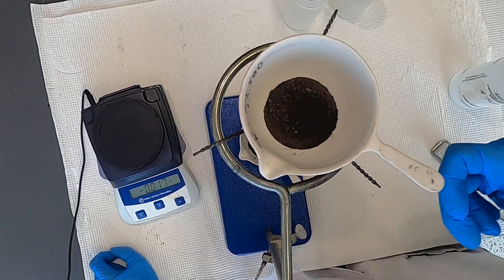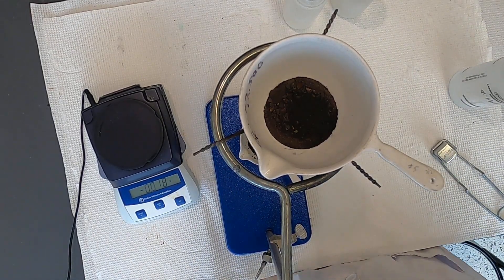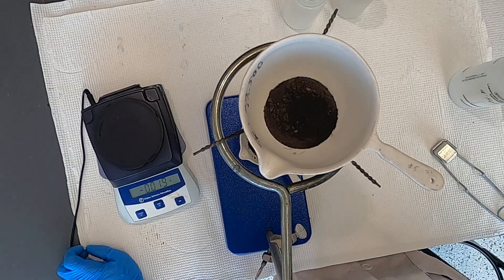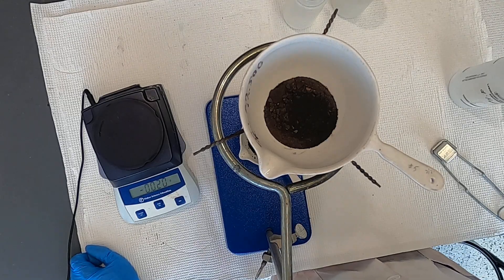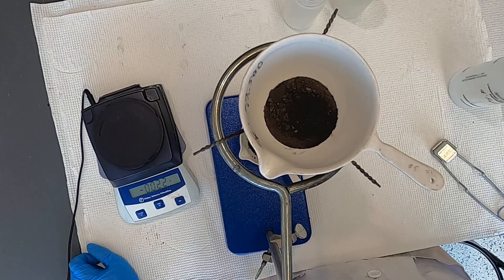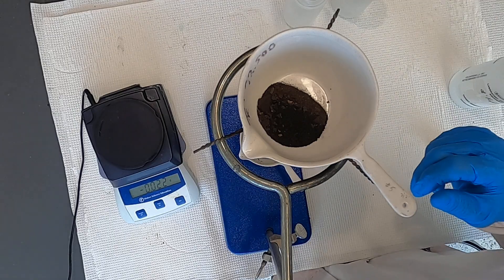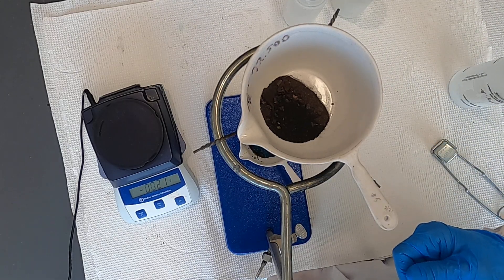It looks just like the material you received at the end of part one, where you took copper and applied heat to obtain copper oxide. Here we did it in a multi-step synthesis fashion: starting from copper sulfate pentahydrate, adding base to get copper hydroxide, then filtering or centrifuging to remove the mother liquor containing other salts, isolating the copper hydroxide, heating it, and obtaining copper oxide. That concludes the second portion of the lab for empirical formula — we look forward to seeing you during the lab sessions.